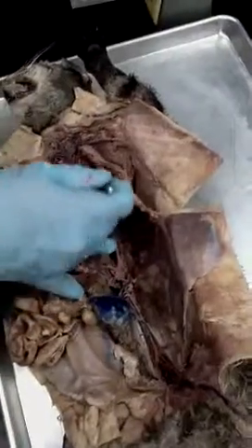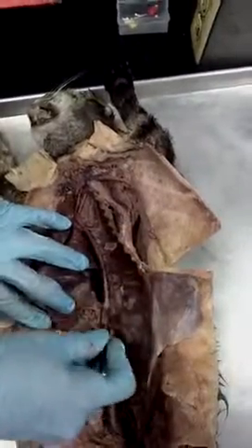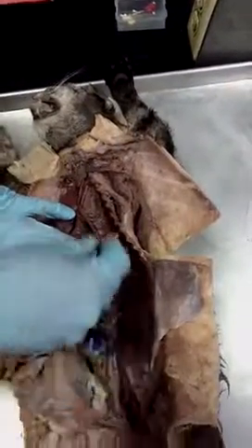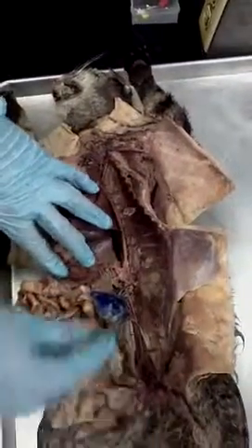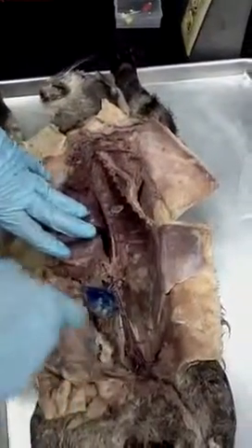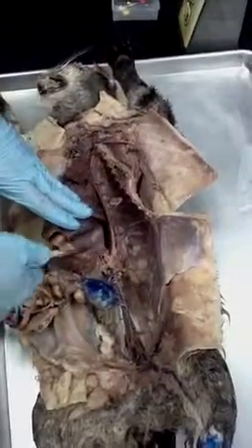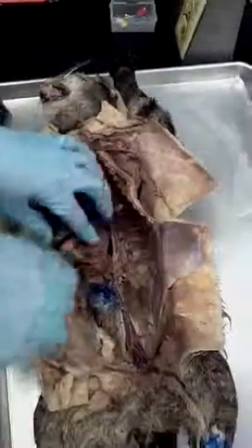Start with the arteries going down from the heart. So following the aorta, we've got the thoracic aorta coming down this first section of the heart, or the dorsal aorta. The thoracic, then the abdominal. It's the same artery, it's just positioning. Remember the thoracic body cavity, abdominal body cavity. If it's above the diaphragm, it's the thoracic. Below the diaphragm, abdominal.